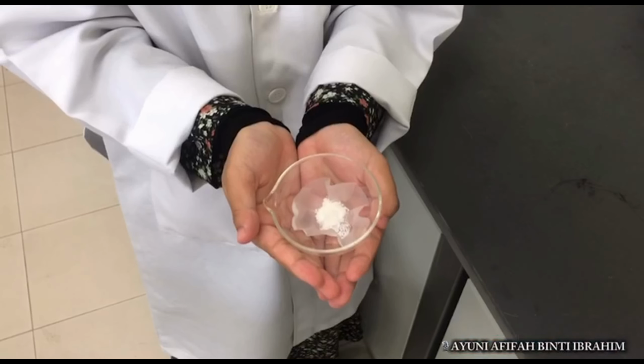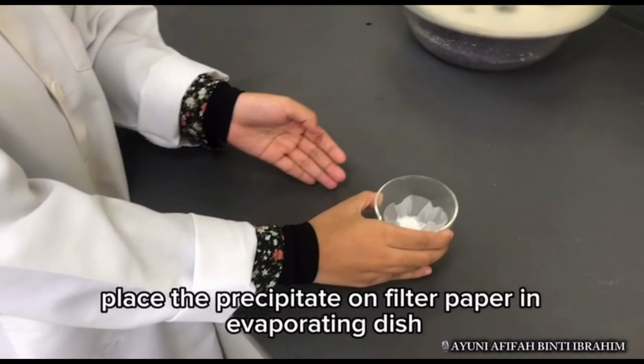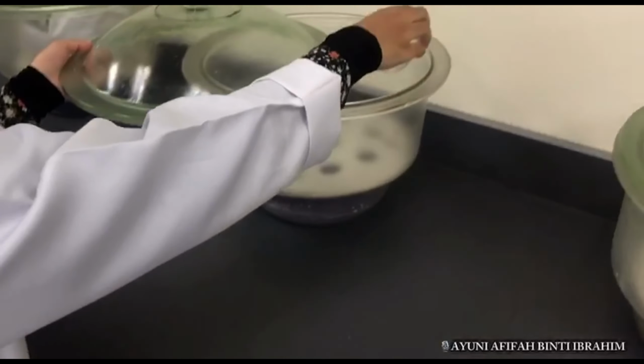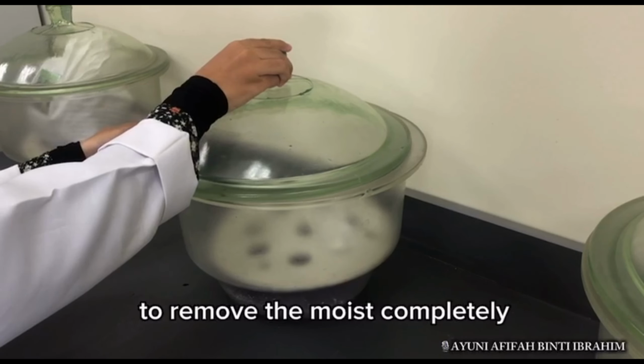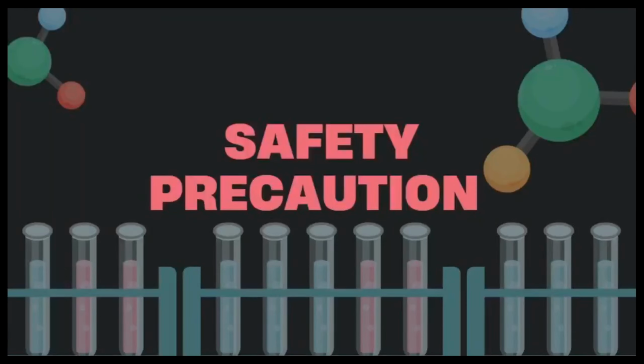Last step, drying. Place the precipitate on filter paper in evaporating dish. Transfer it into desiccator carefully. Seal the desiccator tightly and leave it overnight to remove the moisture completely. Then we will get a powder paracetamol.